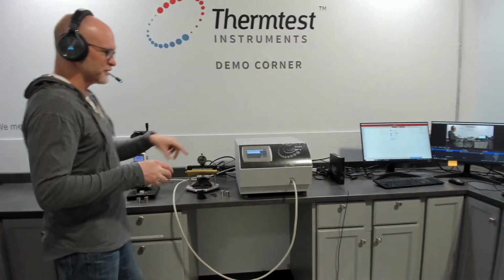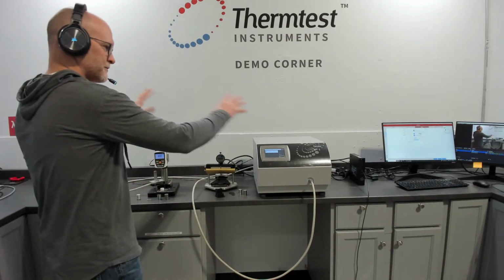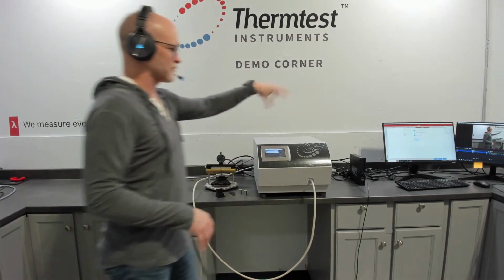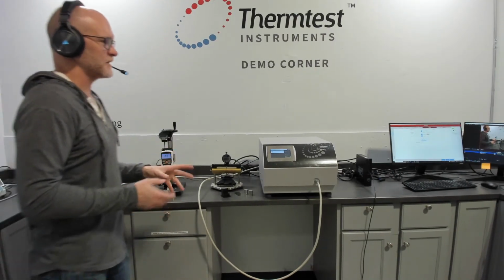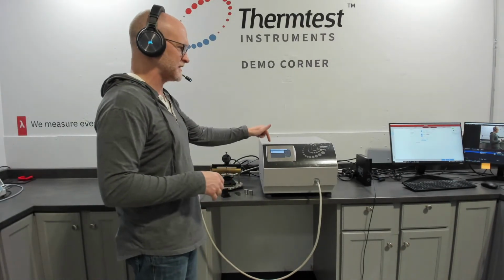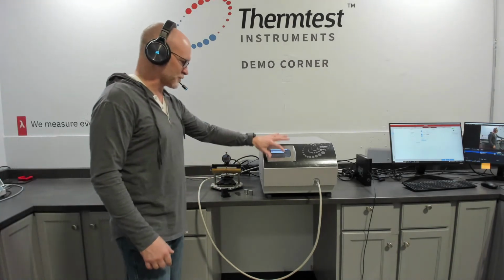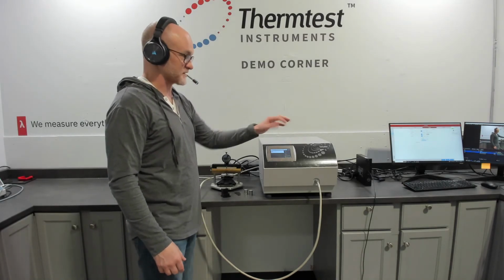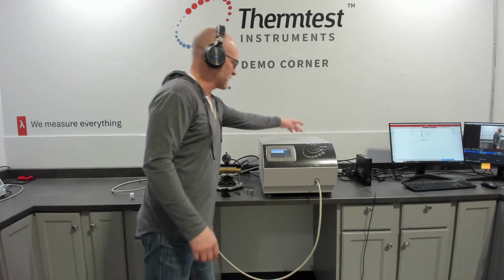So coming back to our MP1, today we really want to focus on this package. So what we did is we stripped away the temperature platforms. We didn't want to talk about some of the other capabilities, but as a summary, I always walk into what's unique about the MP1 controller. The MP1 controller has 4 channels. You can kind of see or partially see maybe these 4 boxes, but they actually represent how many channels are available. So there's 1 channel in the front, 3 in the back.